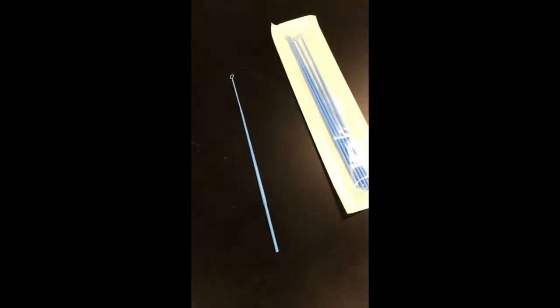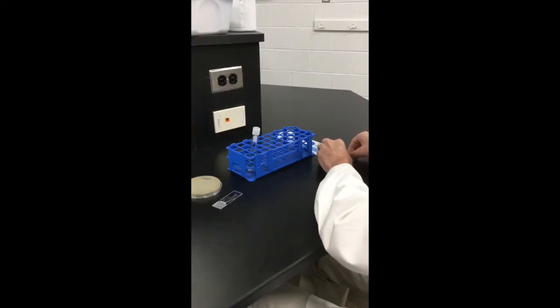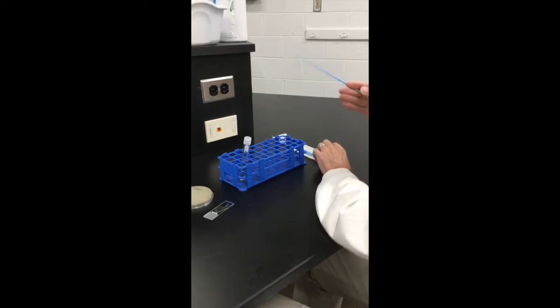In our lab, as in many clinical laboratories, we use plastic disposable loops. These come pre-sterilized from the manufacturer and must be carefully removed from their packaging individually.